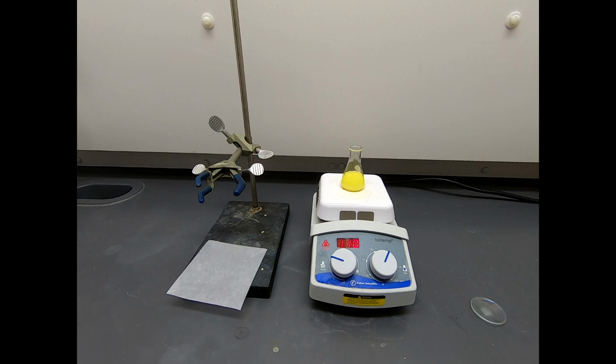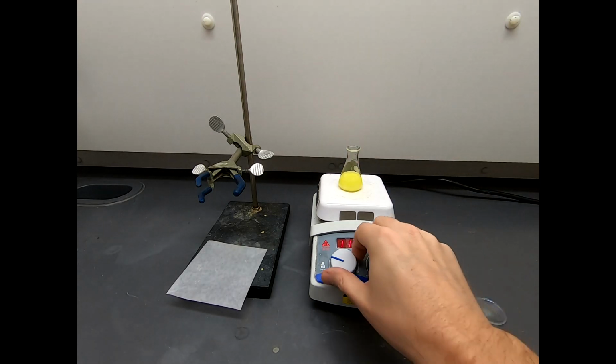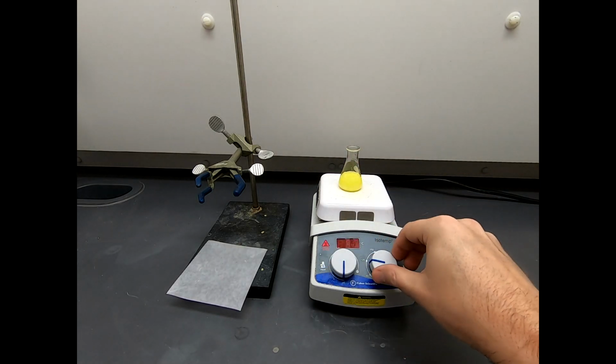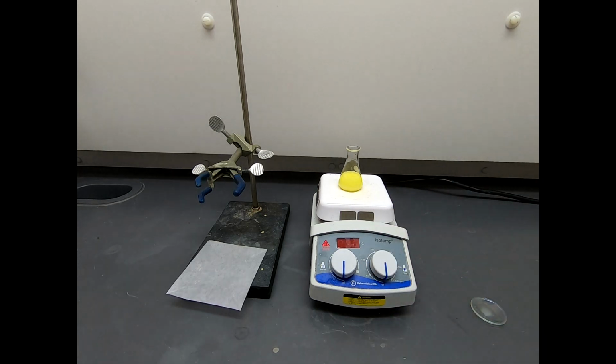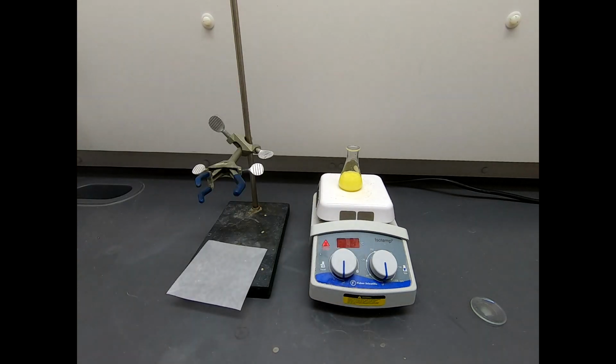So now, once we hit the cloud point, we just let this cool. And as you can see, we're solid. So let's turn this off. Let this cool. I would guess that stir bar is no longer doing anything. Let's now let this cool, and once it cools close to room temperature, I'll go ahead and put it on ice. We will get some absolute ethanol also cooling, and then we'll be ready to do a filtration of this product, and hopefully it'll be pretty clean.